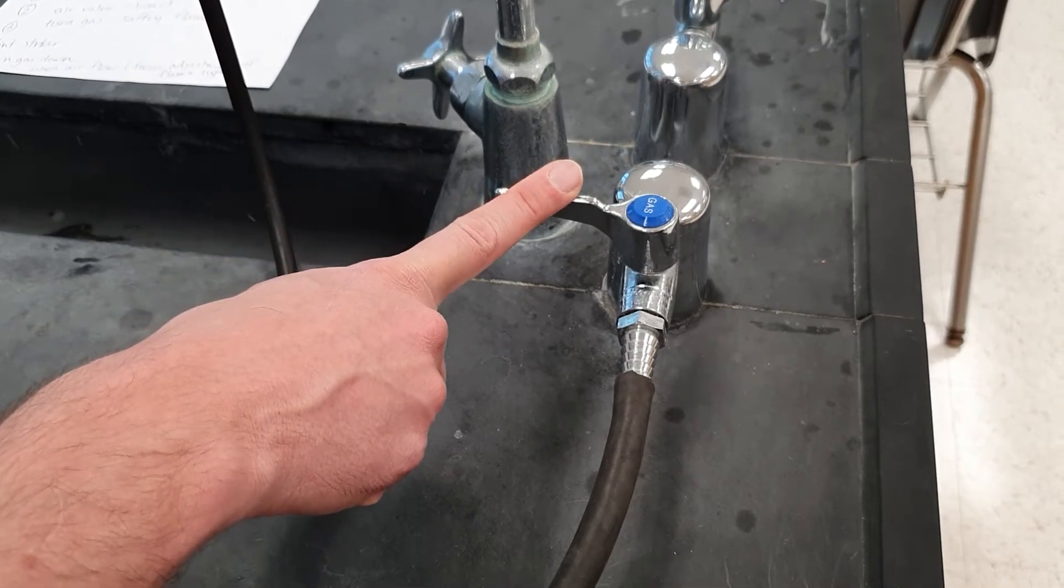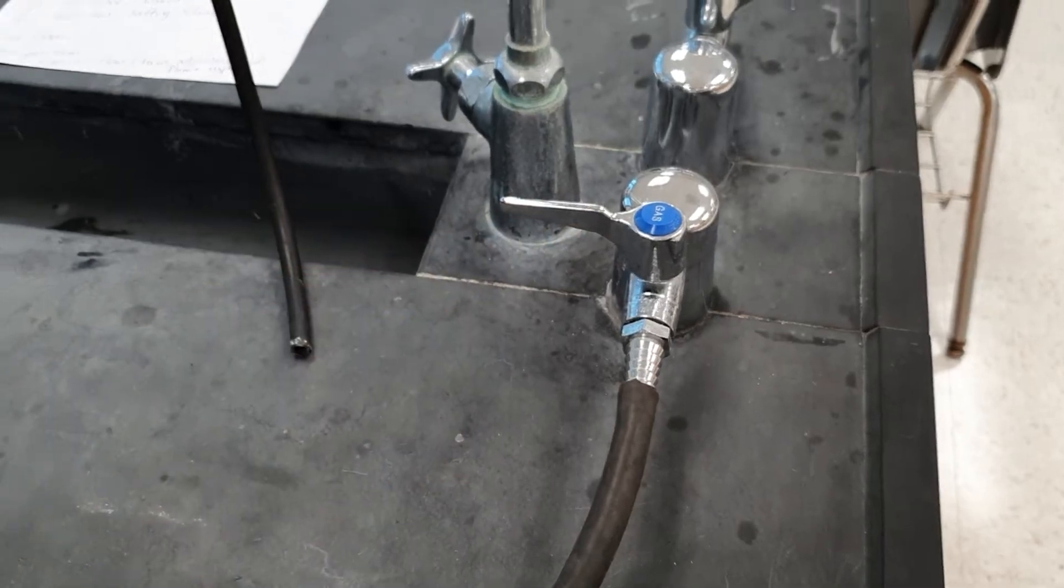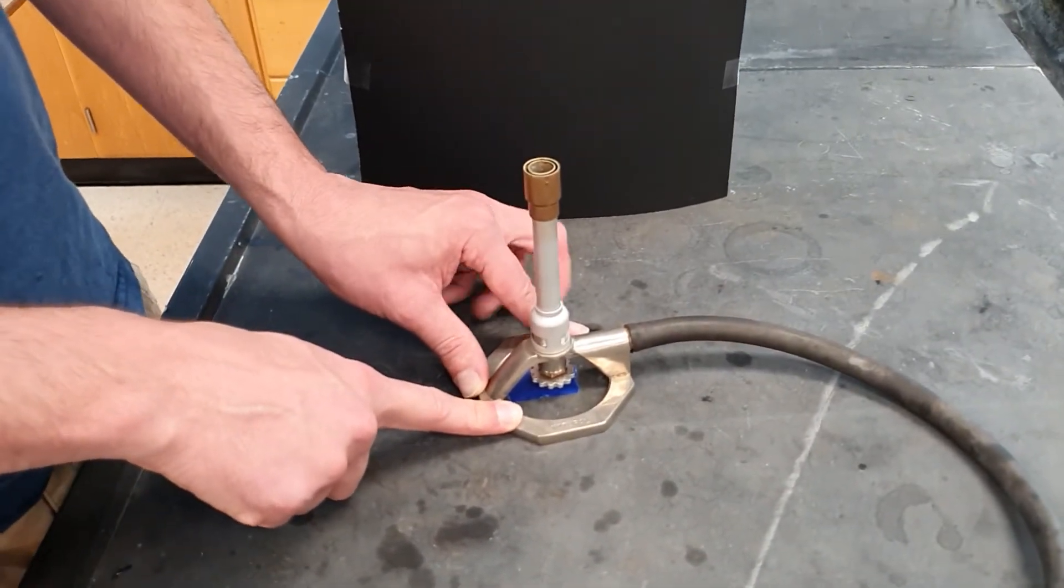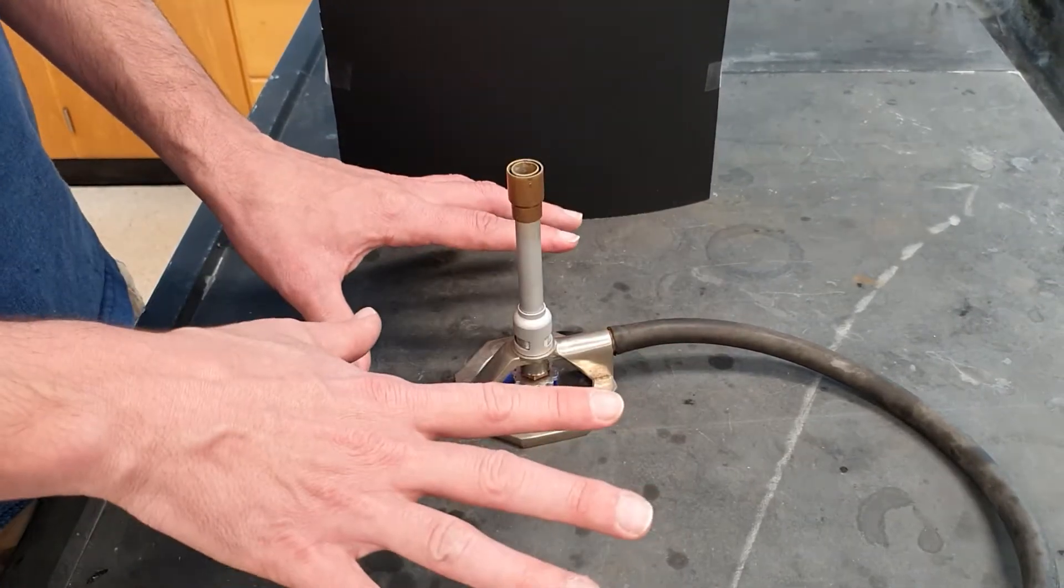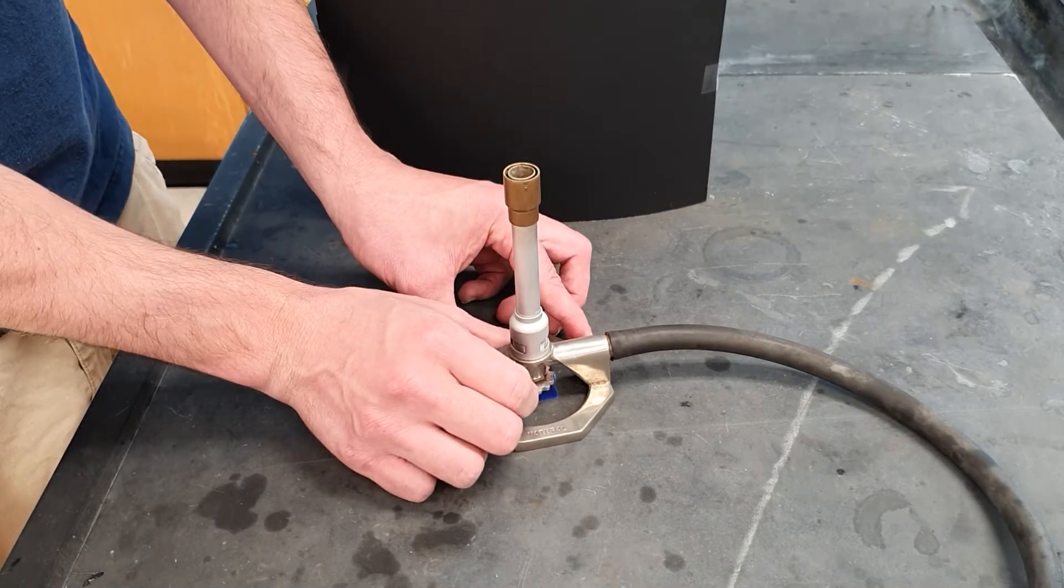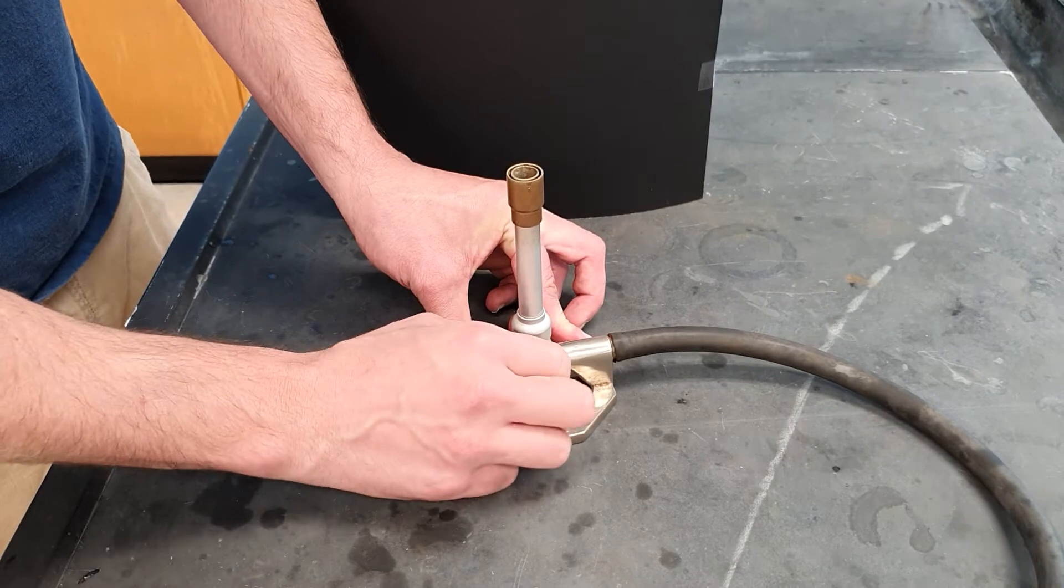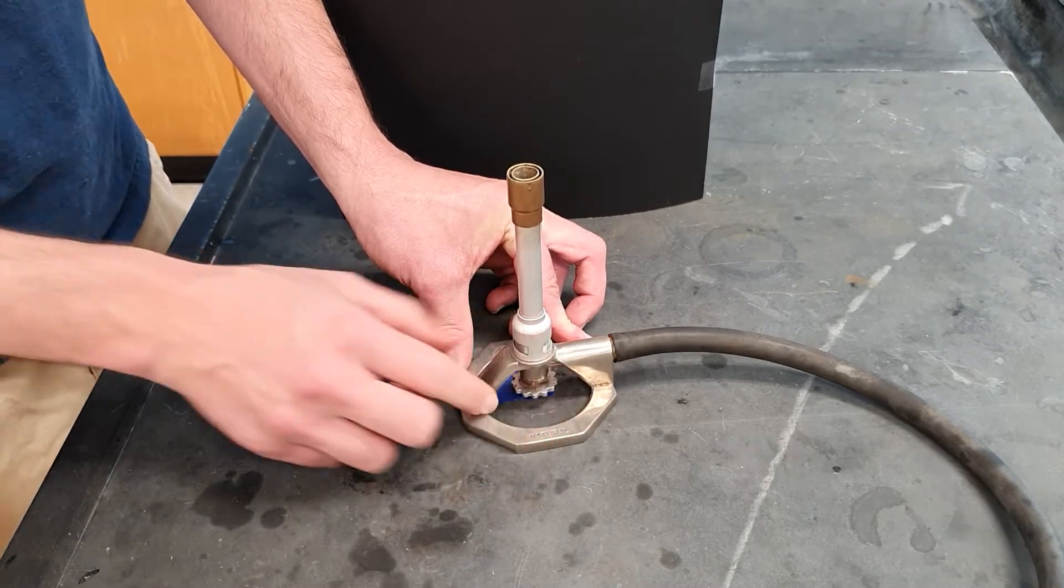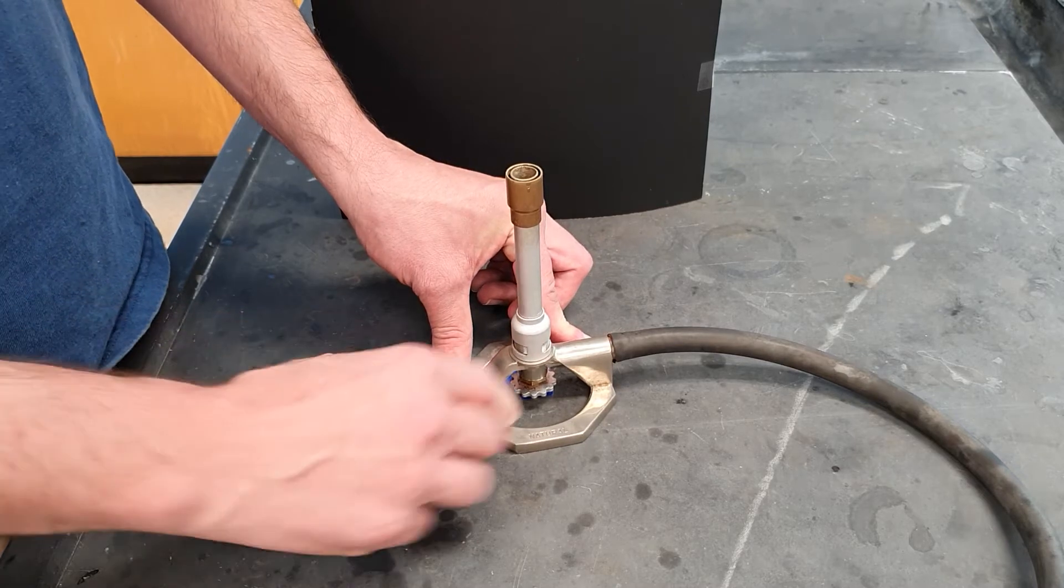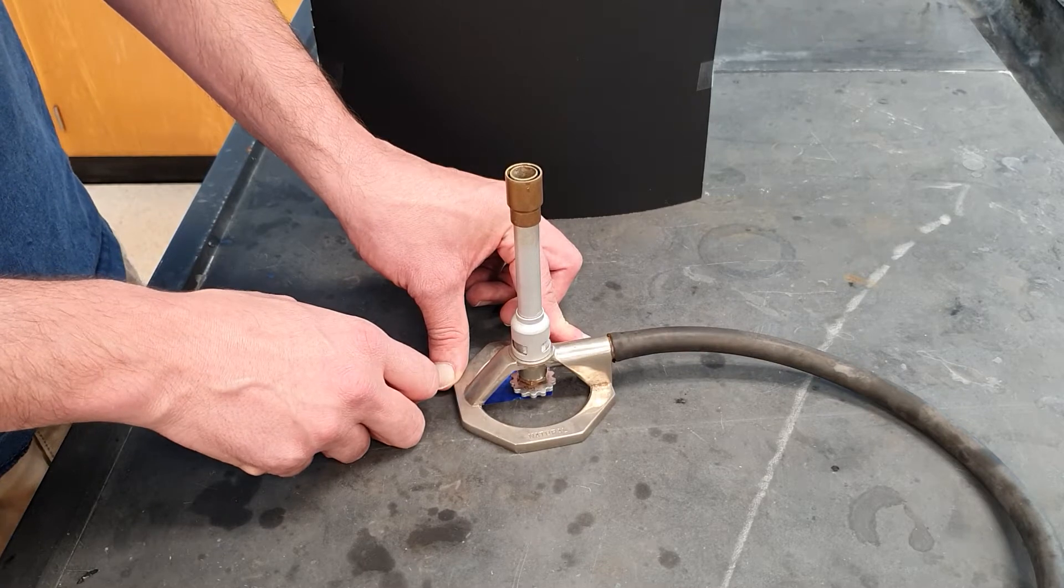So let's talk about now, how do you actually go about lighting and adjusting it? Let's go back and have a look at the gas burner. What you do, when you're ready to light it, and you've checked that all equipment is good, you give this three turns. One, oops, sorry. One, two, three. Now, you notice I tried to turn the wrong direction. That happens all the time. So don't try to memorize which direction I turn it. Just give it those three turns, and that will usually give enough gas flow for this thing to work.